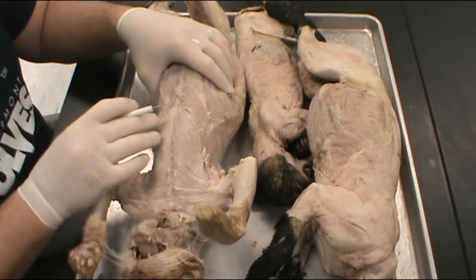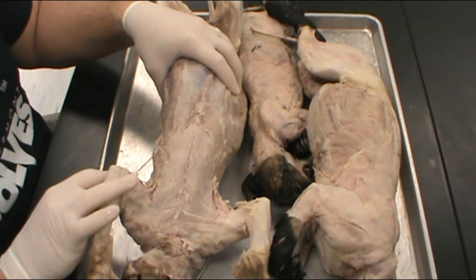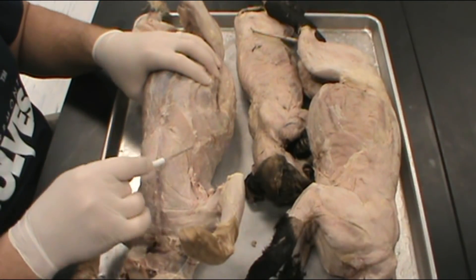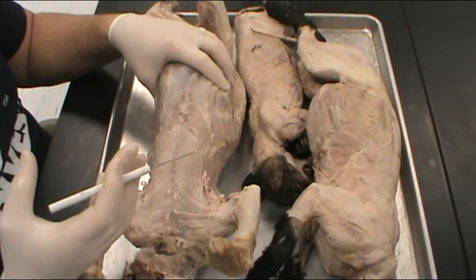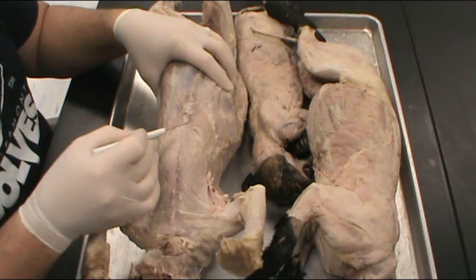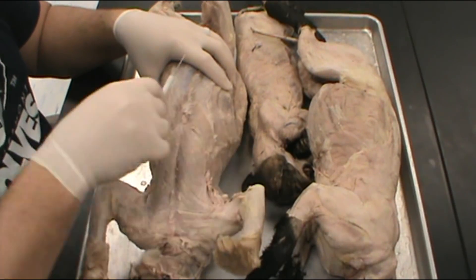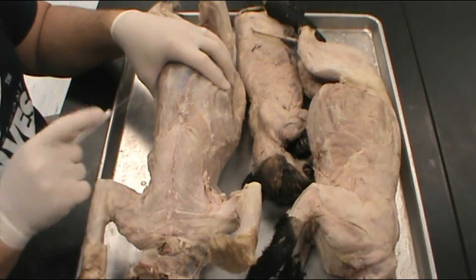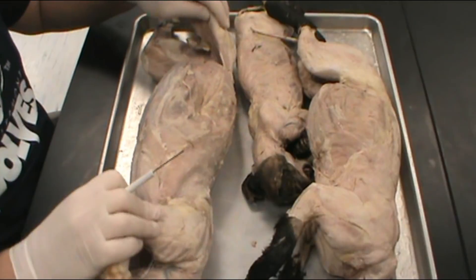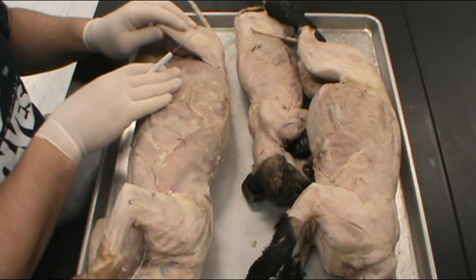The xyphohumeralis — if you're looking at your sheet, that's the muscle starting with X, pronounced the same way as xylophone. It's at the bottom of the V and usually makes a darker muscle. On this side we can see it clearly; the other side it's mostly gone, with just a small tab remaining. The xyphohumeralis is the bottom of the V formed by those chest muscles.